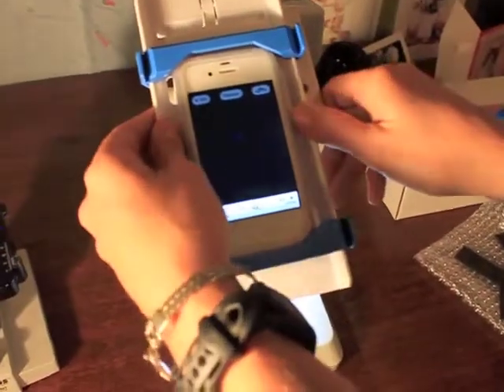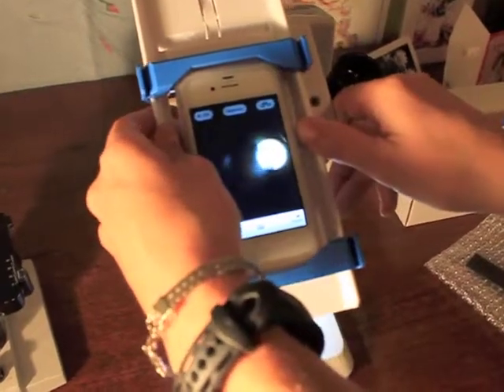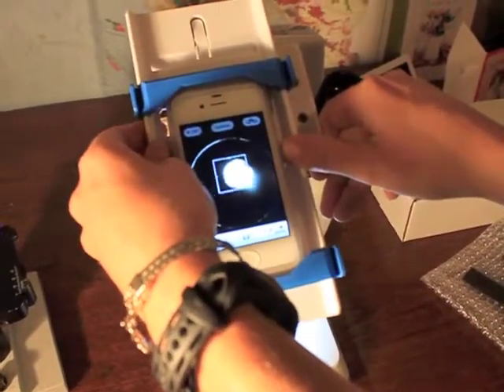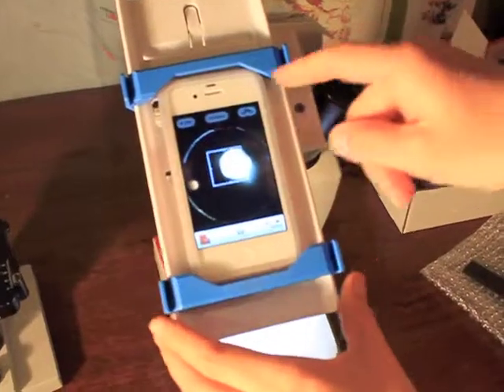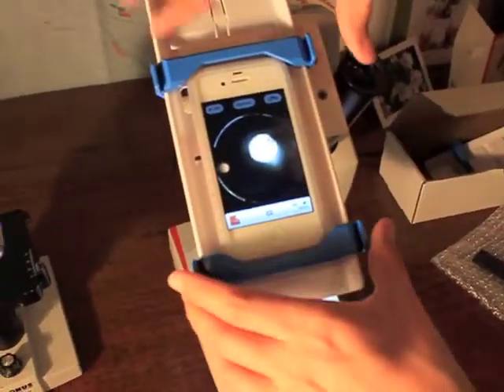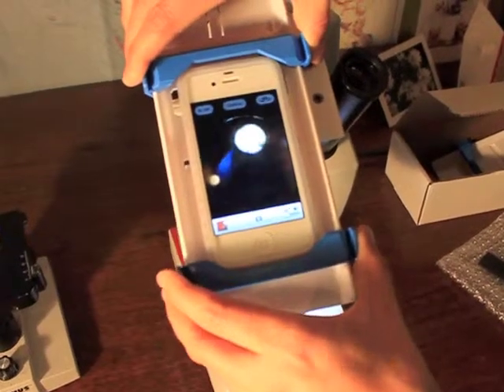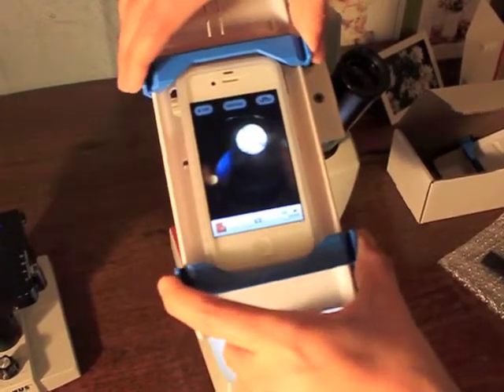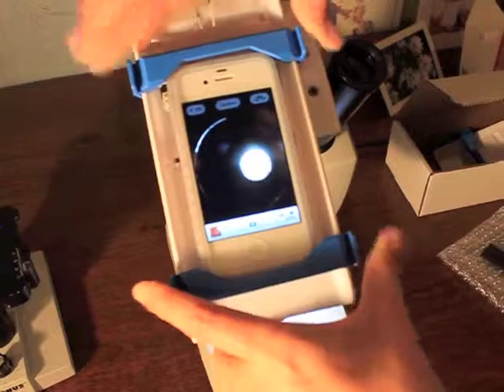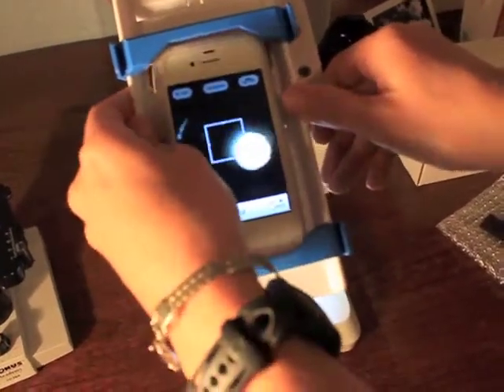Then you can slide it left and right so you see that round circle — that is where the microscopic image is. And then if we want to move it up or down a little bit, maybe down a little, and then back to the right.